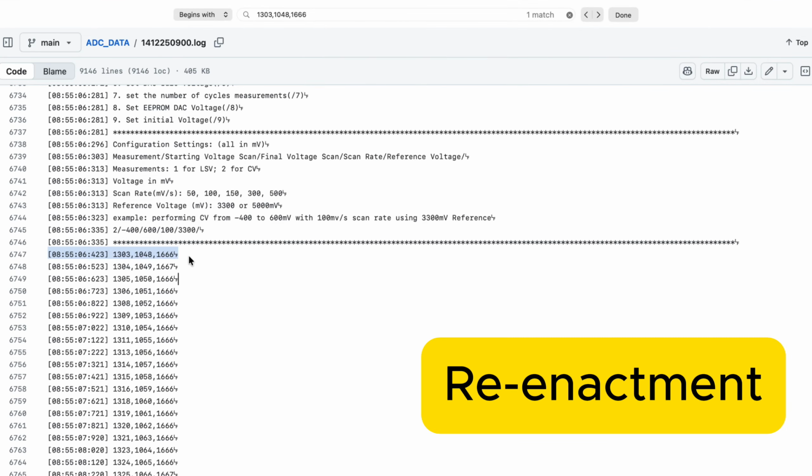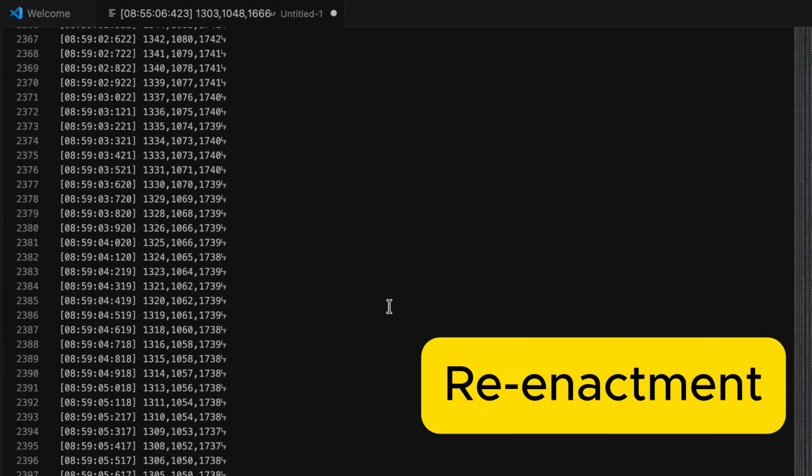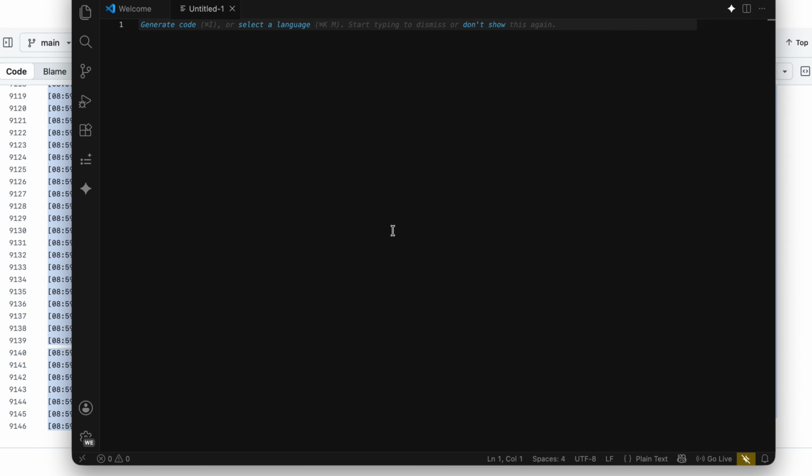First, we copy the measurement data from the log. Then we create a new file and clean the data. Add the column names on top and save it to a CSV file. After the CSV file is created, we run a Python Notebook and include the file to calculate the result and plot it. Doing this once or twice is doable.